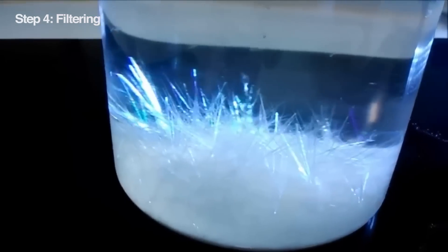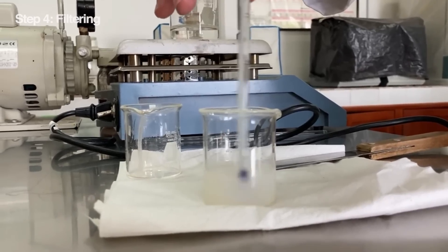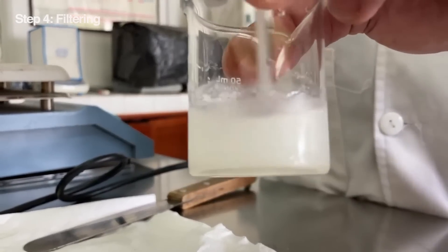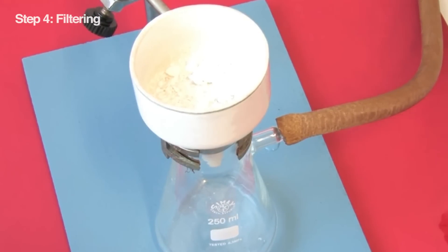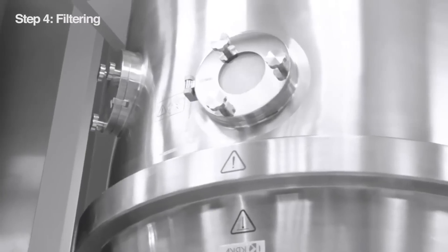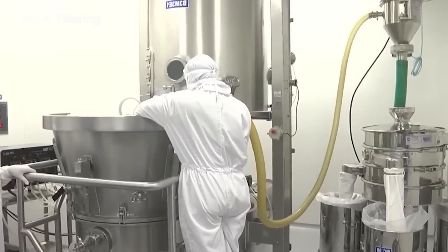Our aspirin has crystallized beautifully, but it's still mixed in with the leftover ethanol solution. We need to separate these two. This is where filtration equipment comes in. We have two main options: rotary vacuum filters or pressure filters. These machines are built to handle big volumes of liquid and solid materials, perfect for our aspirin adventure. The design can vary — some filters have a giant spinning drum, while others use a series of filter plates. No matter the design, the goal is the same: separate the aspirin crystals from the leftover liquid.